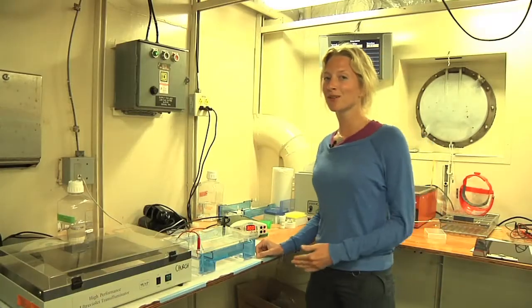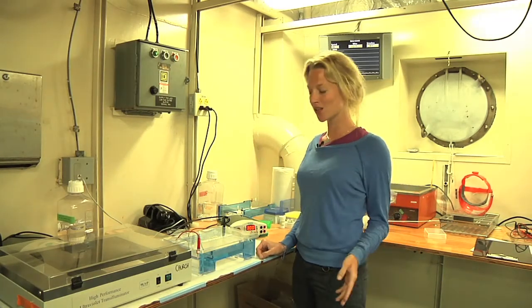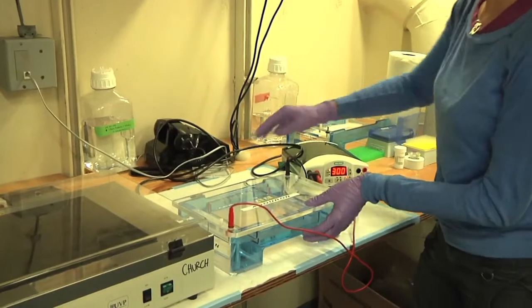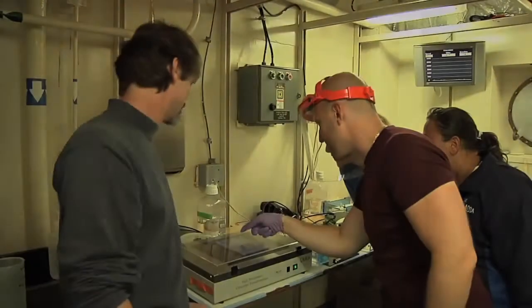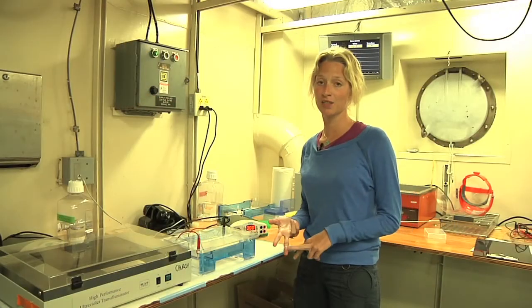Okay, so this is the most exciting part of the experiment, because now we're going to check if the amplification of the DNA worked out. We put the DNA on the gel, an electric current is applied, and according to the size the DNA is separated. Additionally, we put a fluorescent dye, so in the end we're going to see is there enough DNA according to the intensity, and do we have the right size of the DNA so we can continue working.